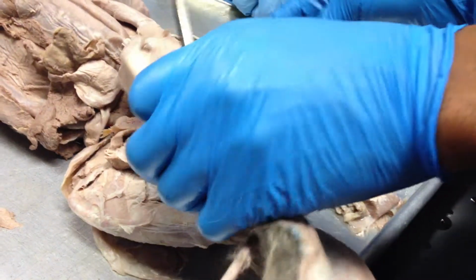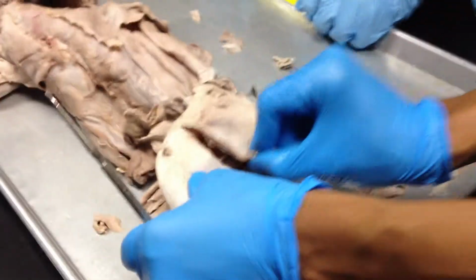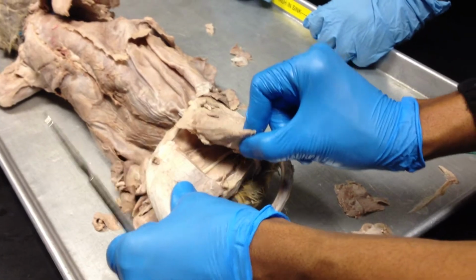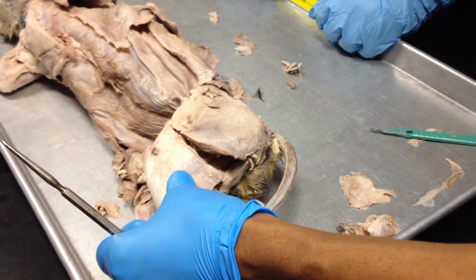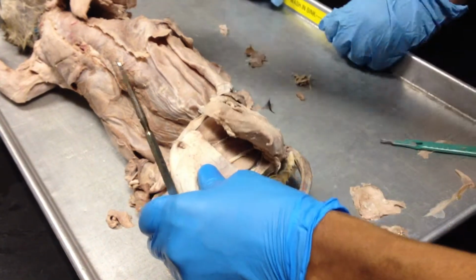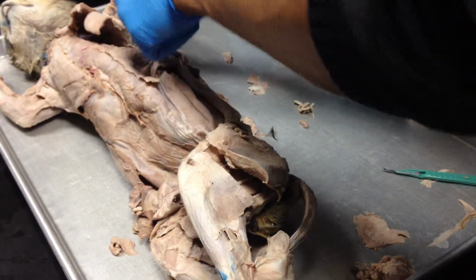And on the outer surface, we have also a very big muscle, the biggest of the leg here, that would be the biceps femoris. Okay, so cats, they can jump high because of this muscle here, larger. And you've been seeing some of these fibers here.